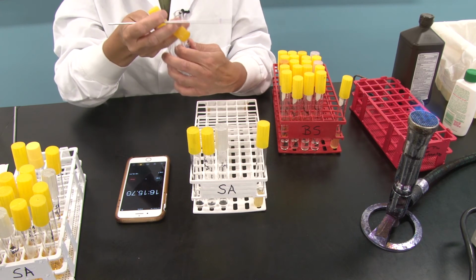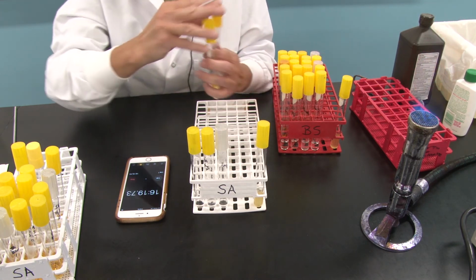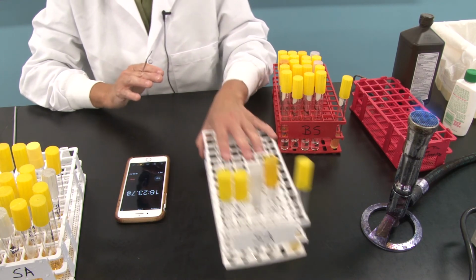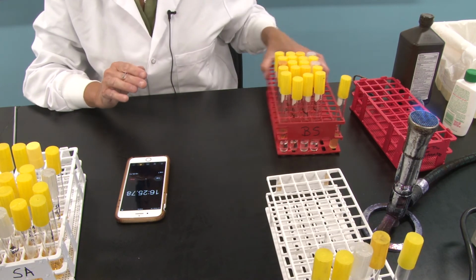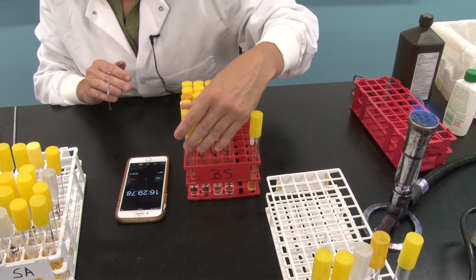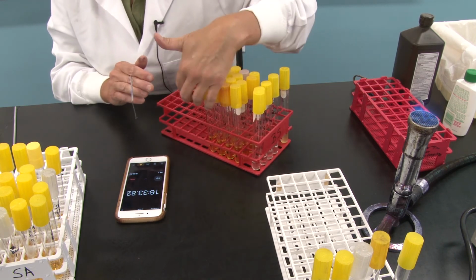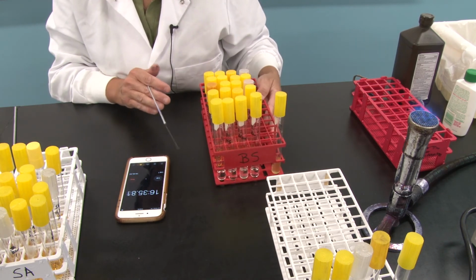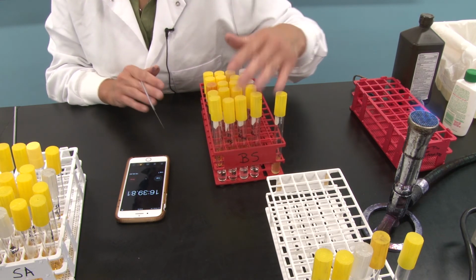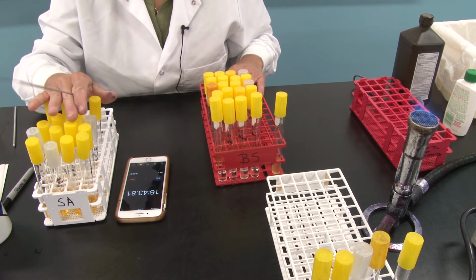Now, I'm not going to make you, as I mentioned, sit through the rest of this with the Bacillus subtilis. However, I do want to mention that we've got the exact same antiseptics and disinfectants, the exact same setup. I've labeled everything. I will go through this. The difference is Bacillus subtilis is a spore former, remember. So we're going to compare this gram-positive spore former with this gram-positive non-spore former.